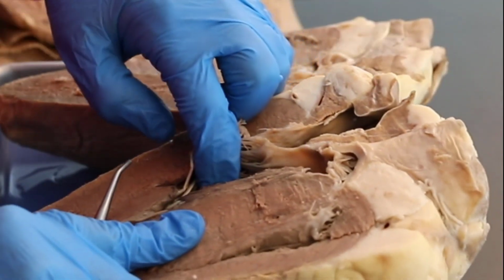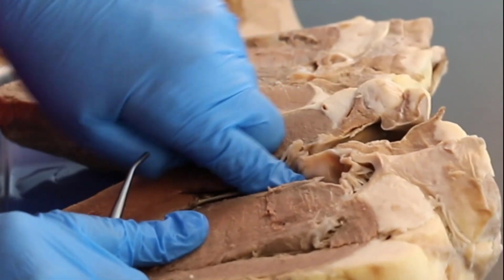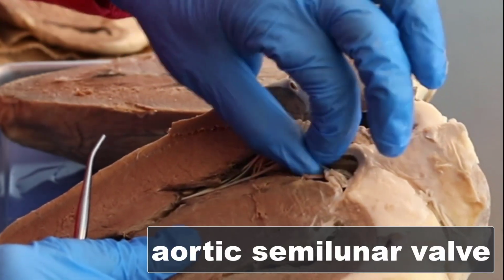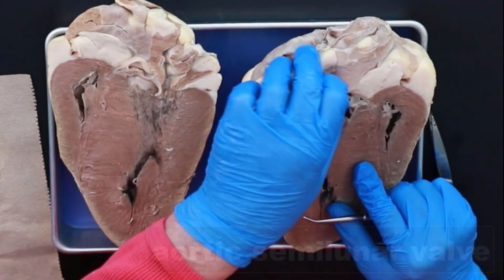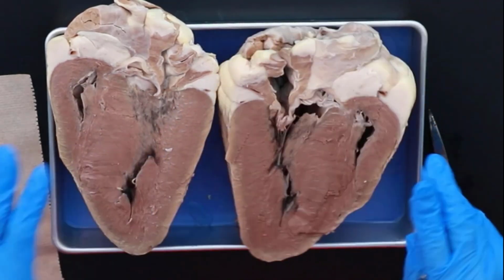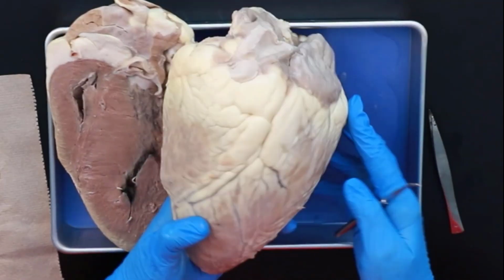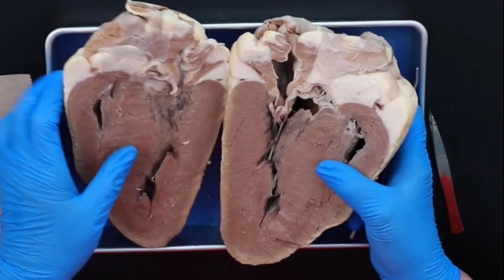You have one going to the pulmonary trunk, which is the pulmonic valve or pulmonary semilunar valve. And you have one going, which is right here. This is the left ventricle. So you're going into, here's your aortic semilunar valve right here. And again, I'll show it to you on the sheet. All right, so I just wanted you to see a bigger picture of this to make it a little easier.